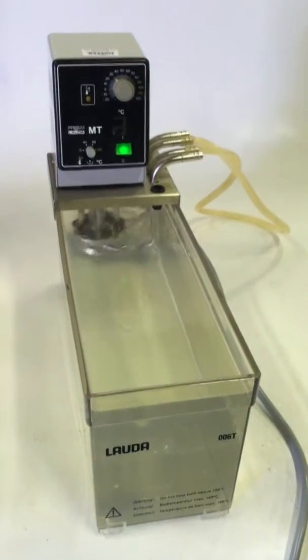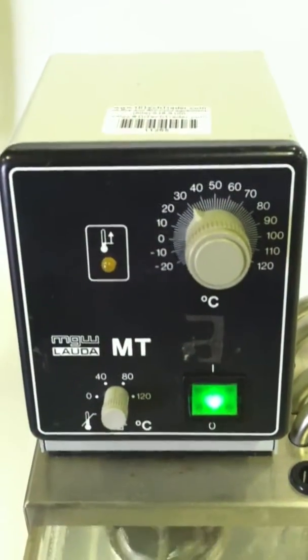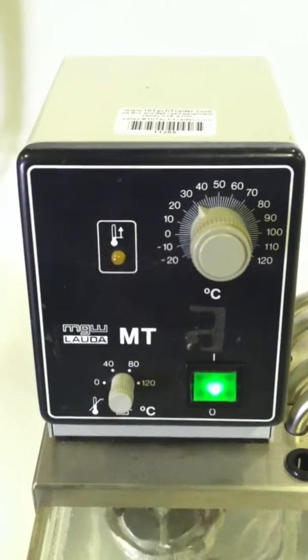From hightechtrader.com, today we're looking at a Lauda MT recirculating head on a 6-liter bath.